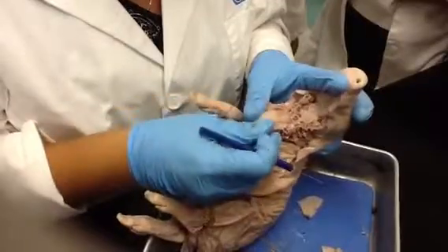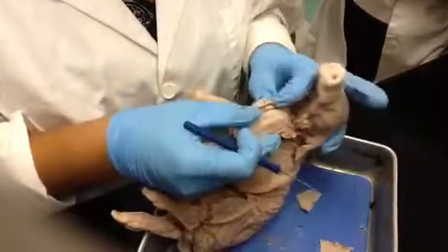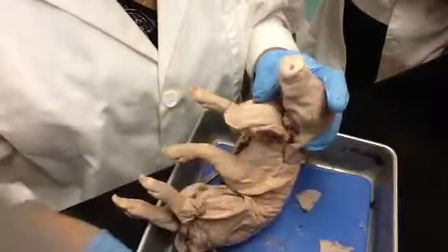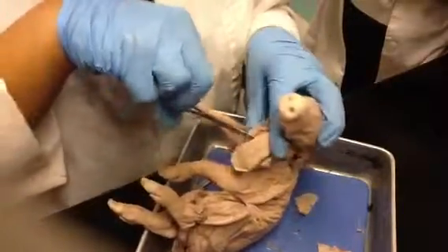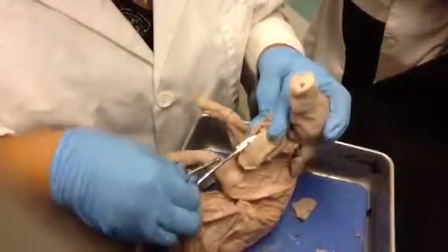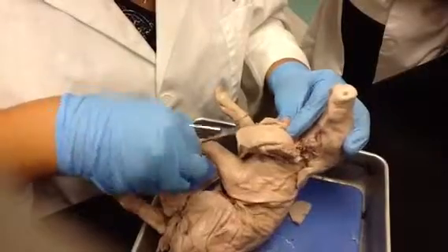And then the teeth, they're in the jawbone, obviously. So this is the jawbone right here. Even though this is for next time, I'm just gonna go ahead and do it this time. I know the teeth are on for next time, but I'll just go ahead and pop out a tooth right now, so you can kind of see the structure.